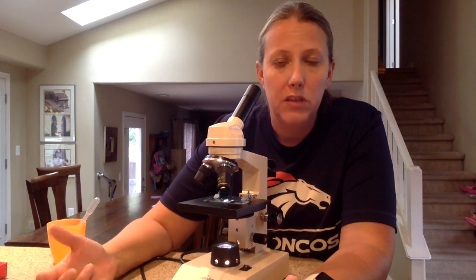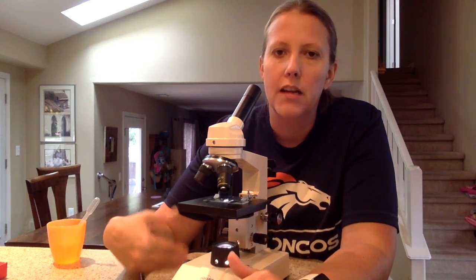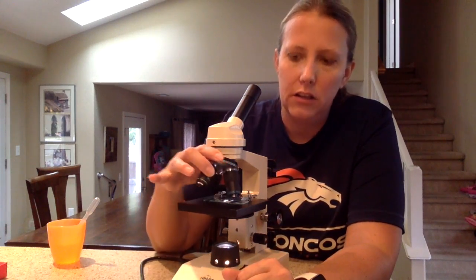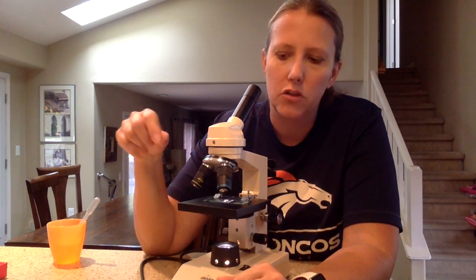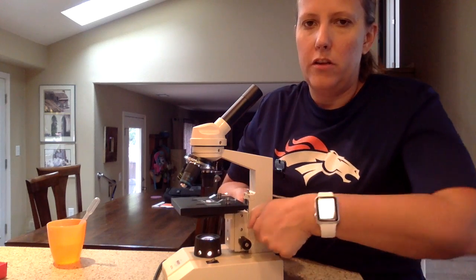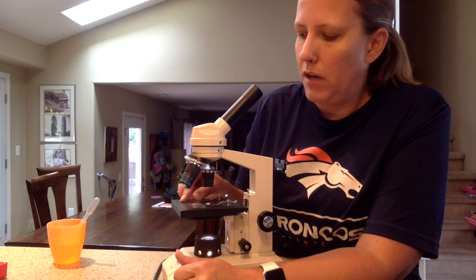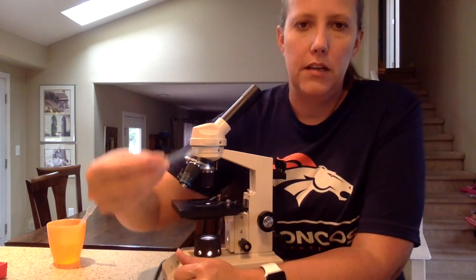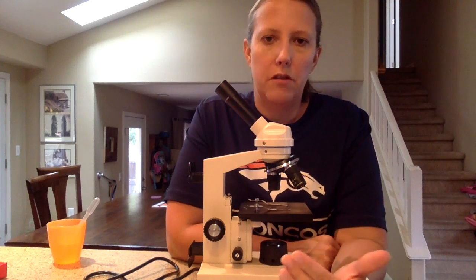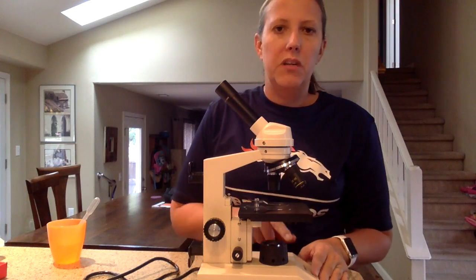When I'm done, I go ahead and clean up my microscope. This is where students make the most mistakes because they forget to be safe when they're done. They're very careful all the way through focusing, but when you're done you need to be careful too. As soon as you're done, the first thing you need to do is go back to the low power lens — that's the safest lens and the hardest one to scratch. Once you're on the low power, then you're going to lower the stage all the way. Now you've got the most room to take the slide out without scratching any lenses. Take the slide out and clean that up. Turn the light source off. If another class is coming in right after you, you can leave the microscope plugged in and just cover it with the dust cover — but stage all the way down and the light off.